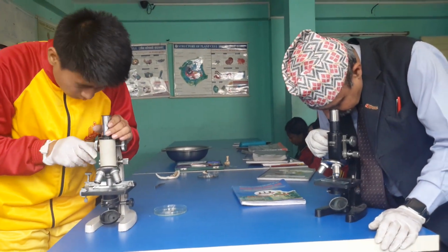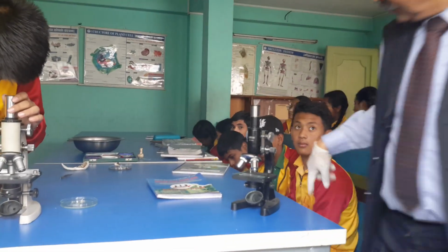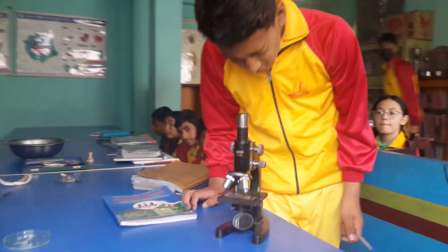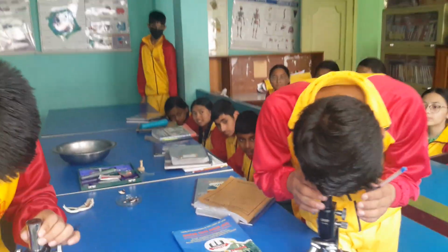Yeah, it is clean. Yeah, you can just observe. Yes, you see, observe.